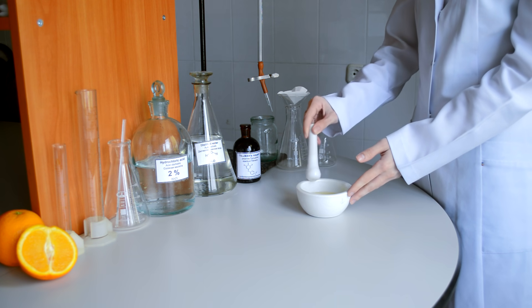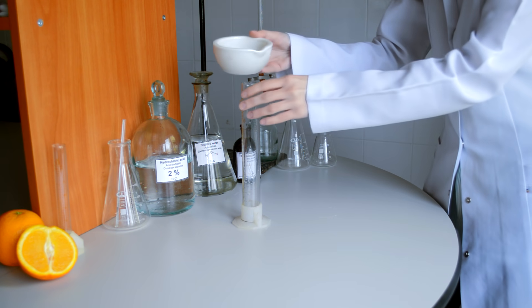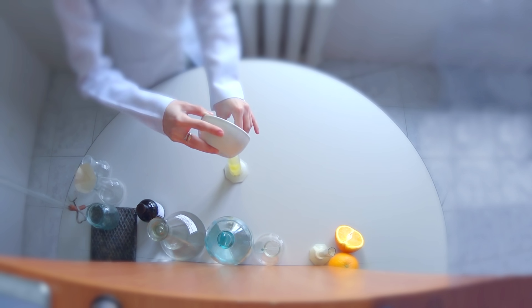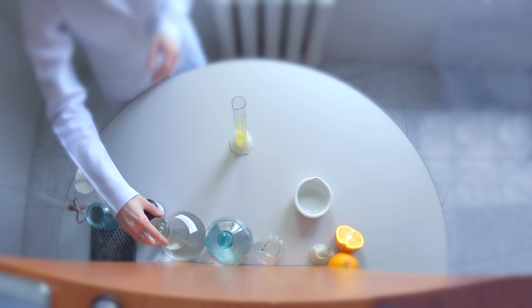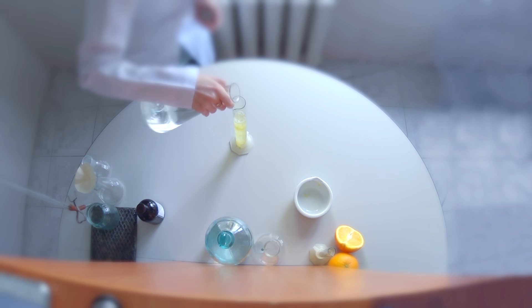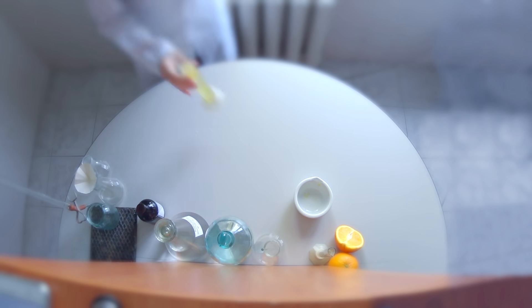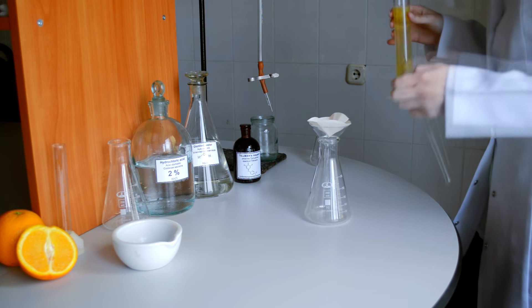After 30 minutes the extraction has taken place, so we put the extract into a graduated cylinder and pour distilled water until it reaches the volume of 150 milliliters. After that we filtrate the solution through filter paper.